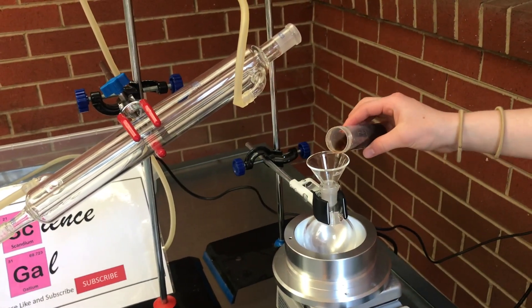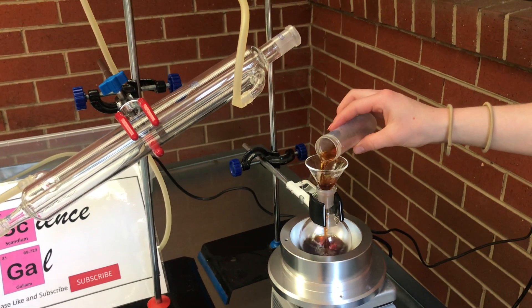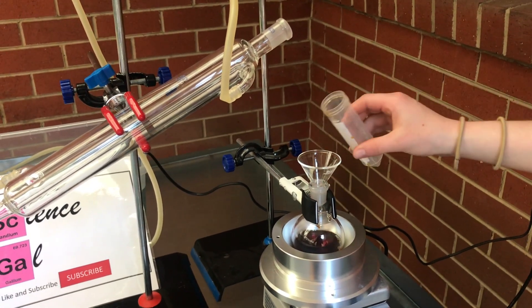As I pour the acetone there is a really unusual smell which is hard to describe but is probably best described as a weird, eggy smell.